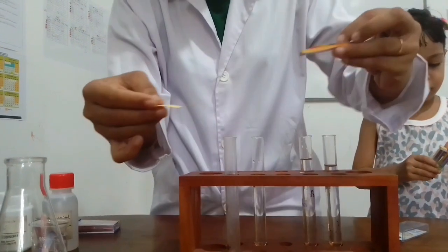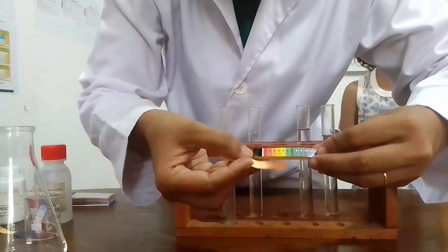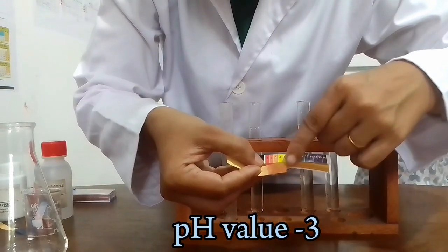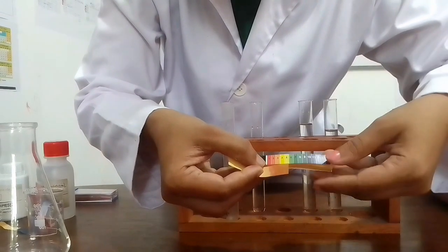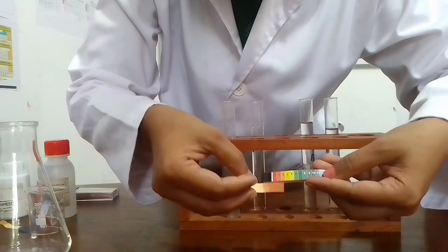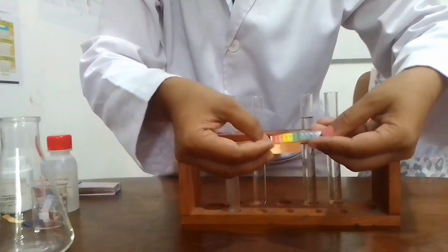Then we have to compare the color of that with this color code. This is the pH paper color code. You can see it's around 3, right? Less than 7. This orange color, the pH of this solution is around 3, right? We have to match this color with this pH paper color scale. That is dilute sulfuric acid.